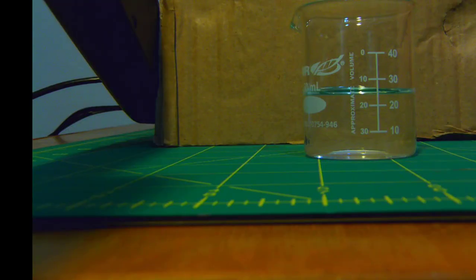Okay, so here we are making the measurement for the beaker. So you can see where the water level is. Look again at the bottom of the meniscus, and you have marks there for 10, 20, 30, 40. So be sure to be guessing the last digit for those measurements.